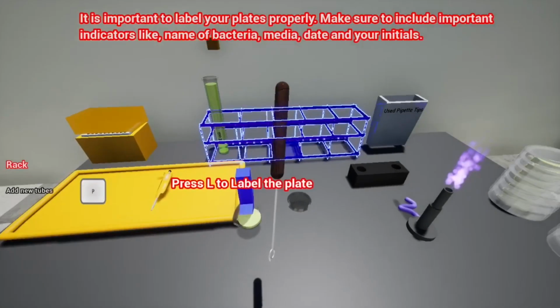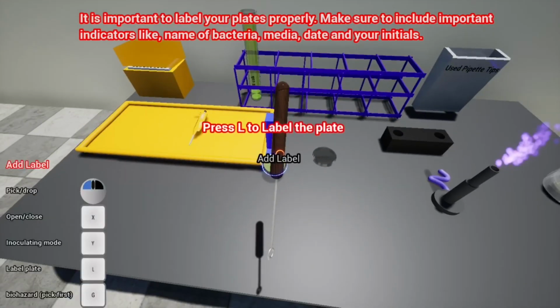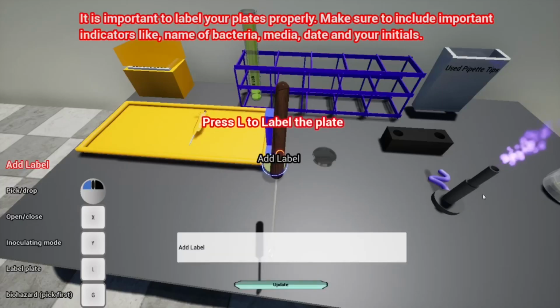Okay. It is important to label your plates properly. Make sure to include important indicators like name of bacteria, media, date, and your initials. So I'm gonna label the plate. I'm gonna label it as streak plate for now. But all those recommendations that are listed over here are very important in your actual lab.